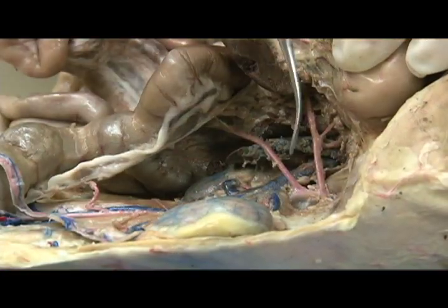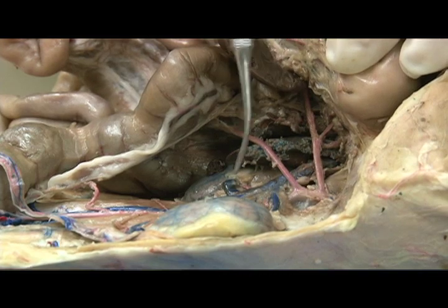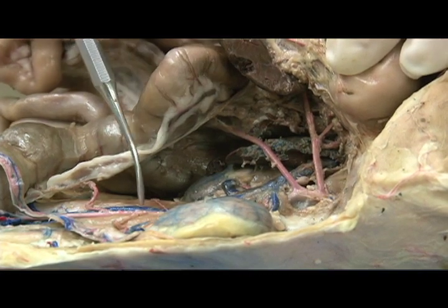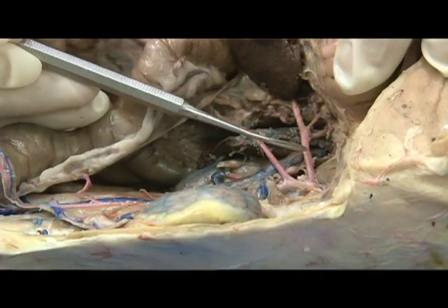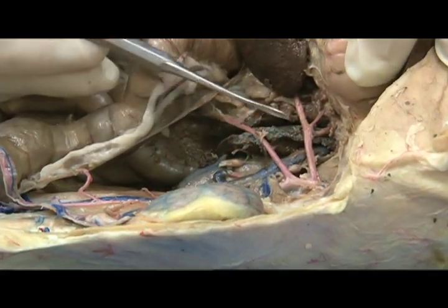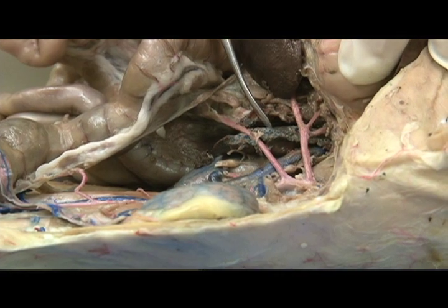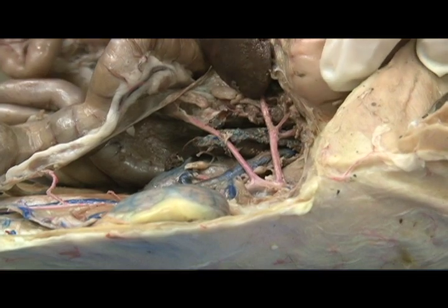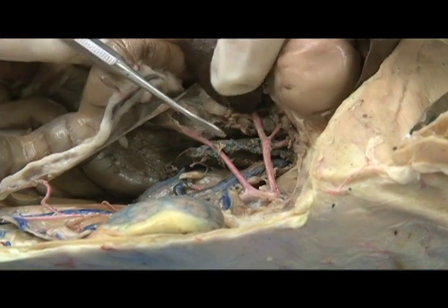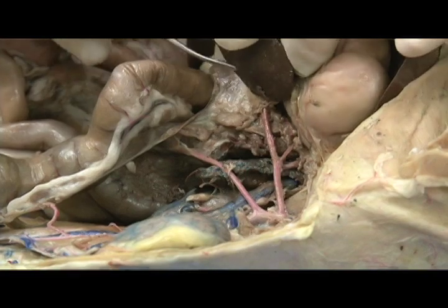The arteries of the abdomen and pelvis include the large abdominal aorta running the entire length of the back. The first unpaired branch off of the aorta is the celiac trunk. It will trifurcate: this is the common hepatic artery to the liver, this is the left gastric artery to the stomach, and this is the splenic artery to the spleen.